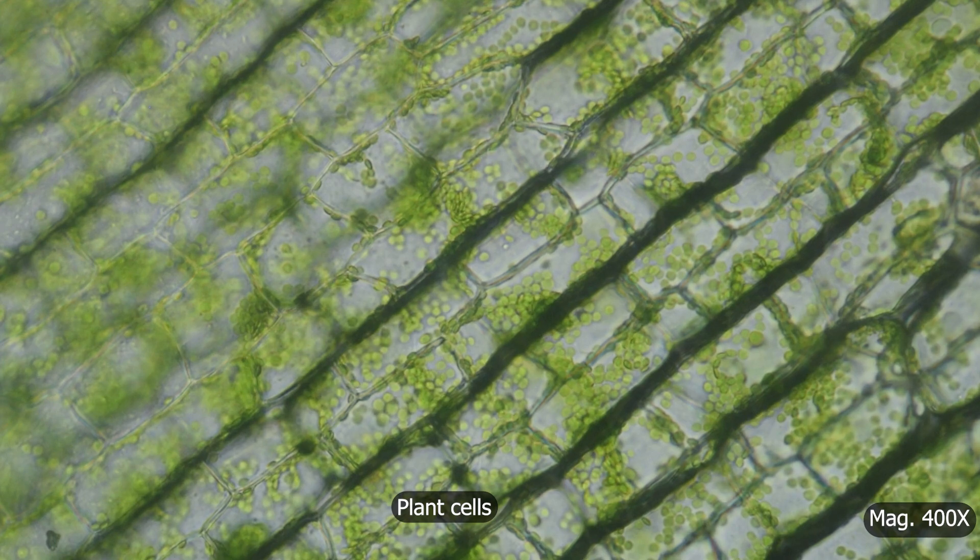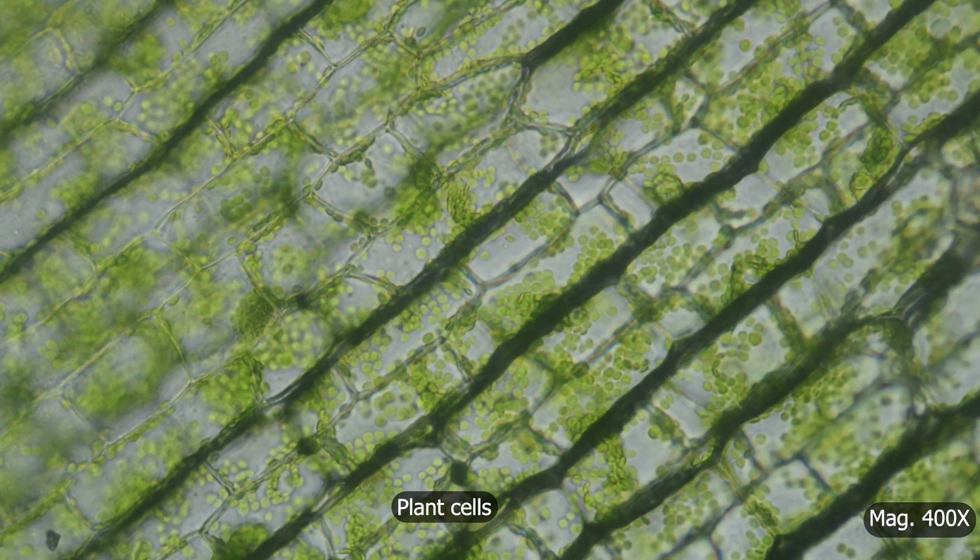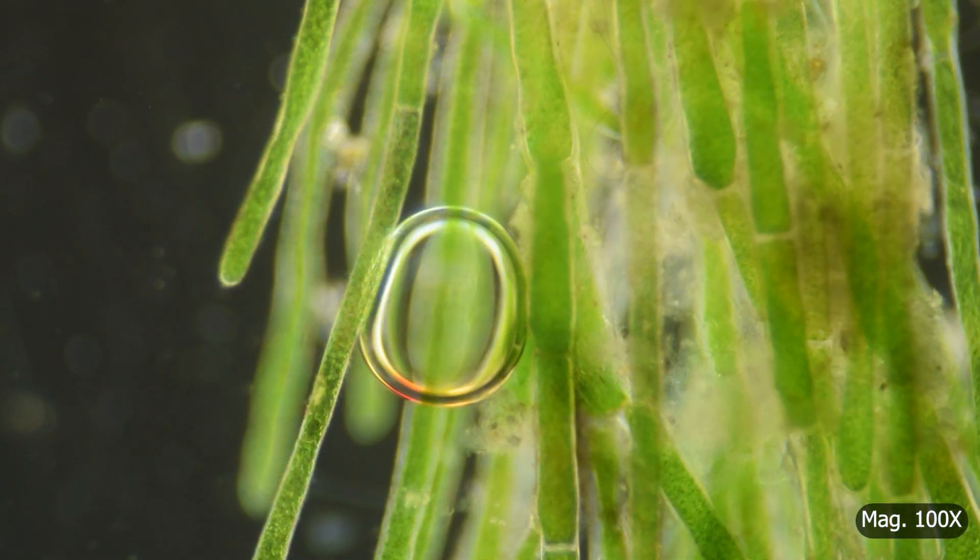I always wanted to do something with photosynthesis. I just didn't have any ideas on how to film it. While filming a marimo ball algae, I noticed a bubble around an algal filament. That is when it hit me. I can use light from the microscope and aquatic plants to produce oxygen bubbles in a water sample.